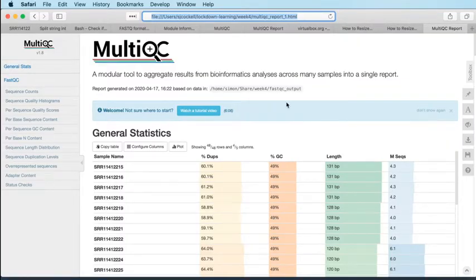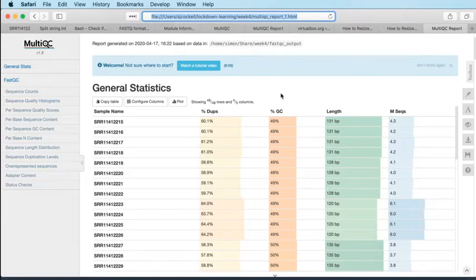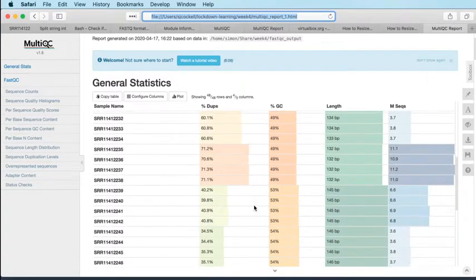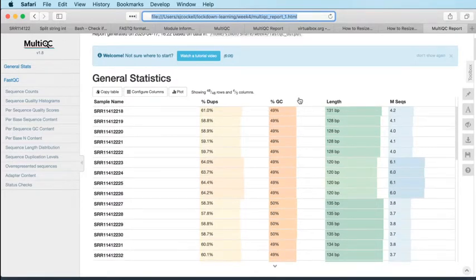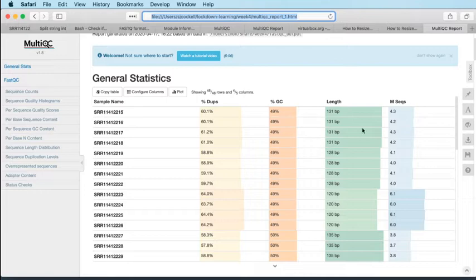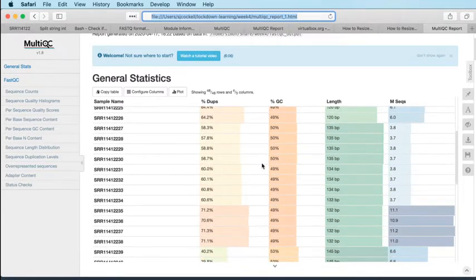So here's the MultiQC report. Yesterday we had just 2 reports in our MultiQC report. Now we have all 48. Okay, so we can scan down this and see where we have any causes for concern. So you can see a higher level of duplication in this batch of 4 here, but also about half again as many reads. So you would expect higher duplication when you've sequenced to greater depth. So that's not unreasonable. Here's another sample where again the duplication jumps up, but again the coverage has jumped up. So once again, not an unexpected finding.